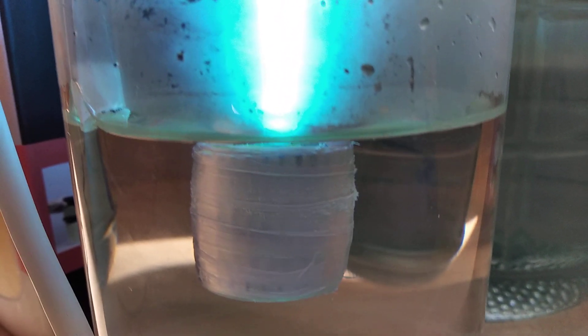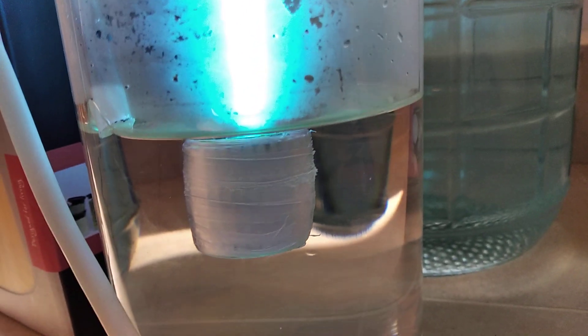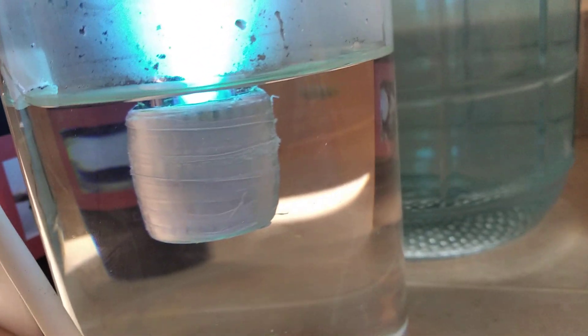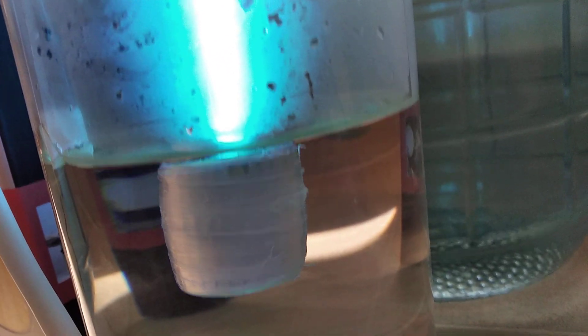The moment that gas enters this chamber it reacts and forms hydrogen chloride vapor and it fogs up immediately. Which is good because that's what's actually acidifying the water below.